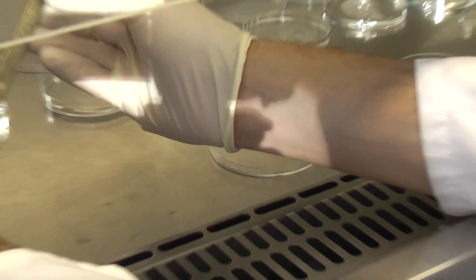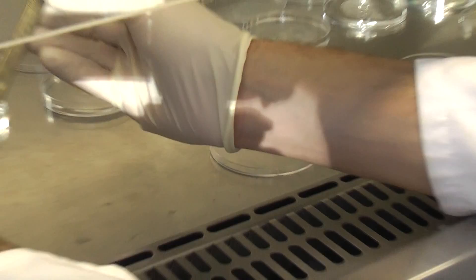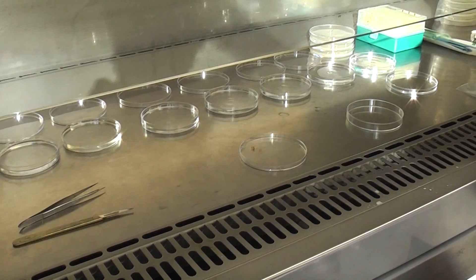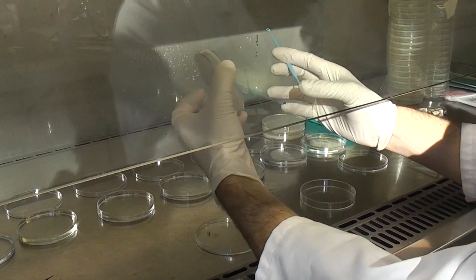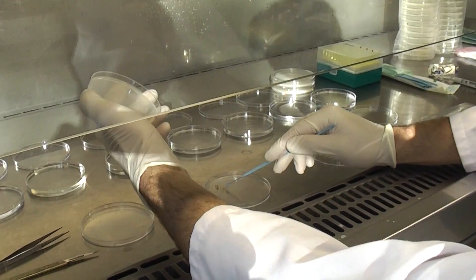And I get what's a sterile loop from over here, and I take a yeast mannitol agar plate. So this is a good growing media for rhizobia. And just touch my sterile loop on some of that nodule fluid.